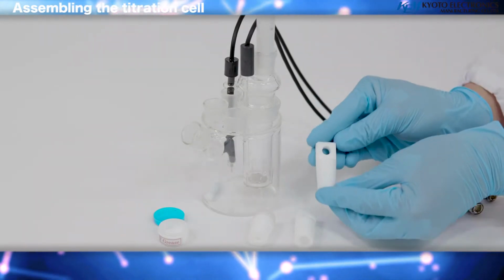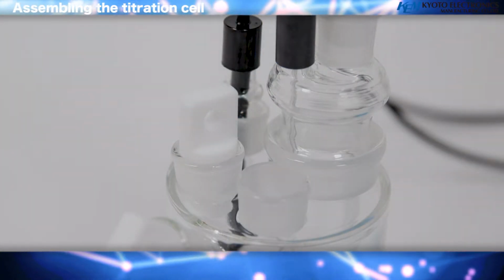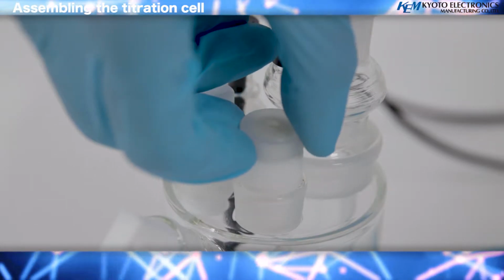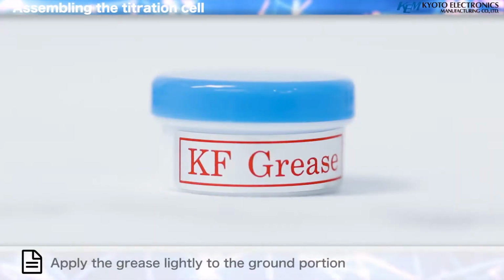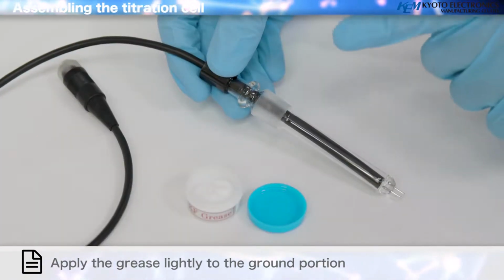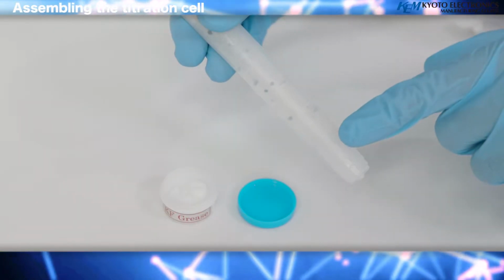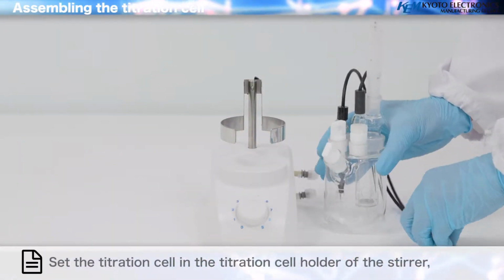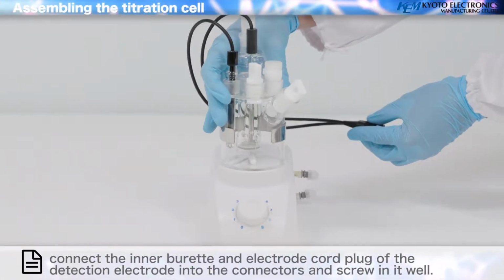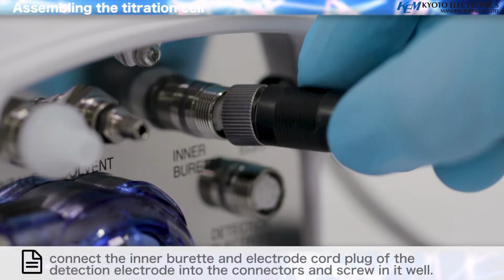Port plug, PTFE. Port plug and the syringe inlet. Apply the grease lightly to the ground portion. Set the titration cell in the titration cell holder of the stirrer. Connect the inner burette and electrode cord plug of the detection electrode into the connectors and screw it in well.